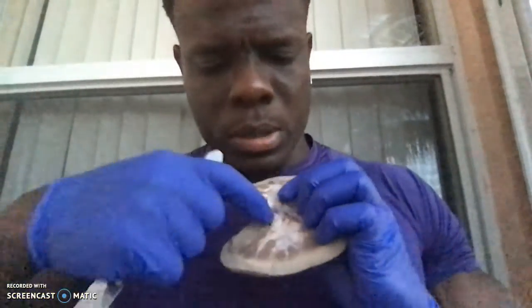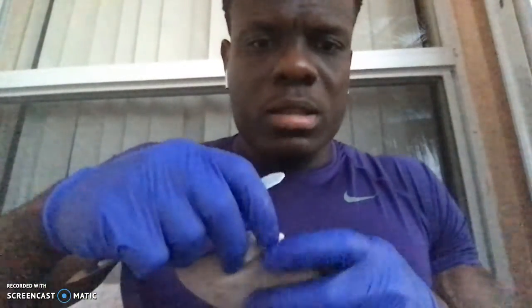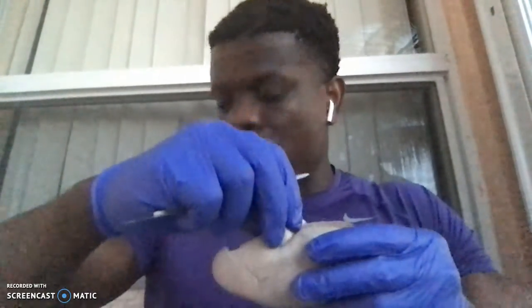It wanted the superior portion of the ureter. So if I go in here and I literally press my hand going straight through this structure right over here, it leads to this outer part right over here. So it's covered by fat, so I didn't get a chance to rip it apart, but that's essentially your ureter right over here, the superior part specifically. So your ureter being the part of the urine drainage. So you're going from minor calyx to major calyx to the renal pelvis to the ureter, eventually draining to the urinary bladder. So that's all the different components of the urine drainage basically. So that's the superior portion of the ureter.